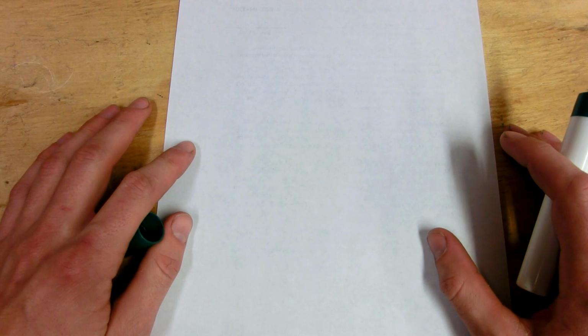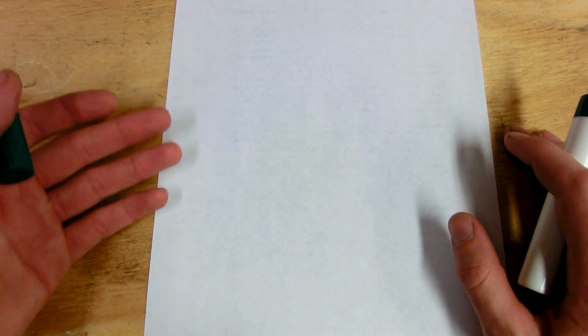Okay, so for this experiment, we need a chemical reaction that produces iron metal. A chemical reaction producing iron metal will typically produce iron metal very, very finely divided in a spongy sort of state, which is perfect for demonstrating the pyrophoricity of iron. It'll be finely divided enough to spontaneously combust in air.